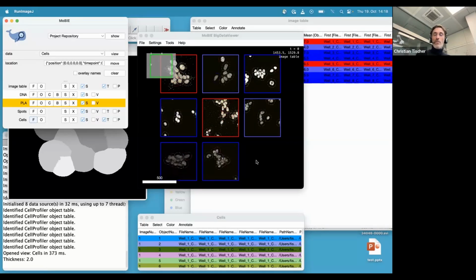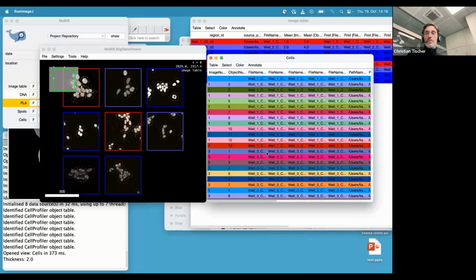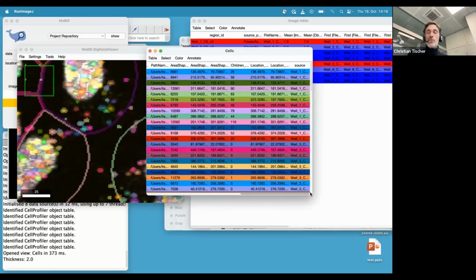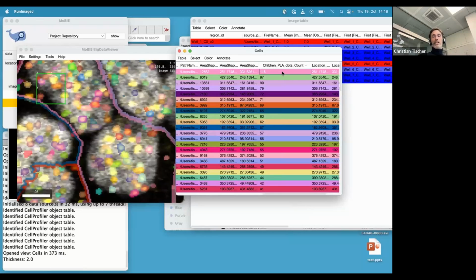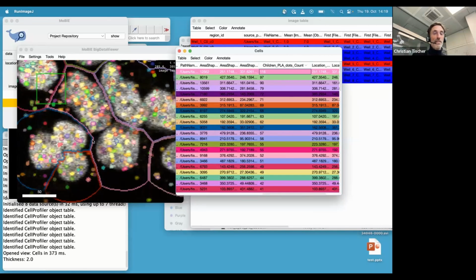And then obviously now, you care maybe in your screen what was the cell that expressed most of these spots? Right, that might be a very natural question you want to ask. And in fact, to be honest, these outliers are often also things where something went wrong, right? So it's a very good way of doing quality control of your data set to look for the extremes. And here is the column that shows you how many dots one cell has. So we can sort and then again click, and it will go to this cell, and it can do that because we stored, as I was saying before, the coordinates of the cell in CellProfiler. And here you see this is the cell with the most spots, and you also see one reason that is the case is because here the segmentation didn't work very well, right? And then you can discover that and maybe then go back to CellProfiler and try to fix it.